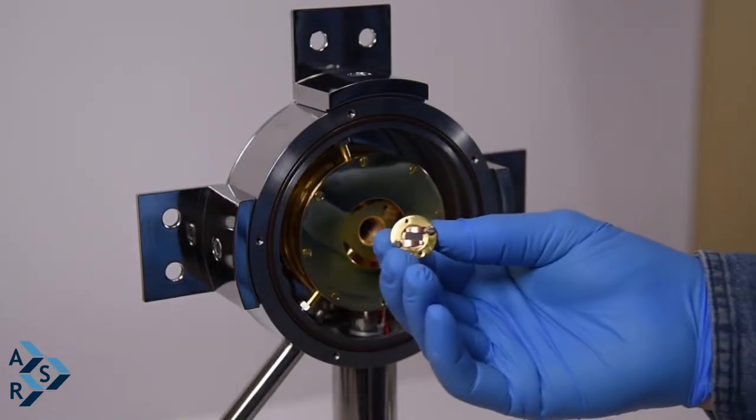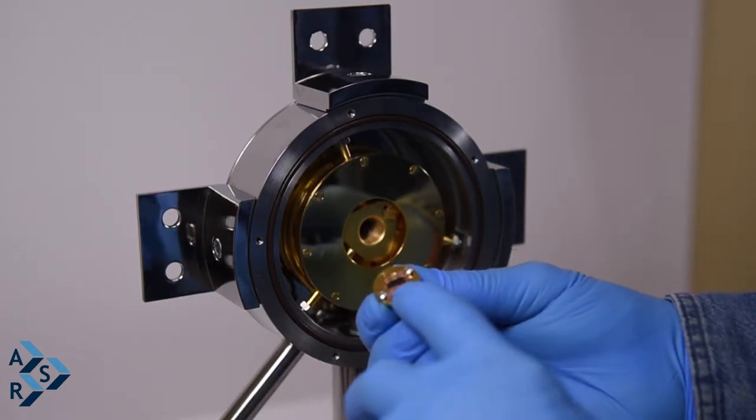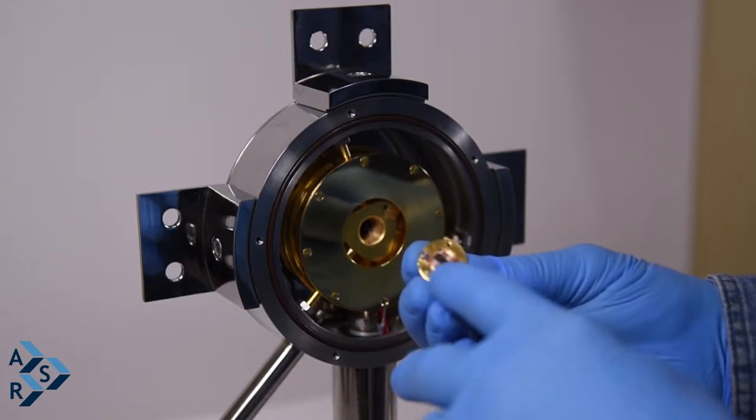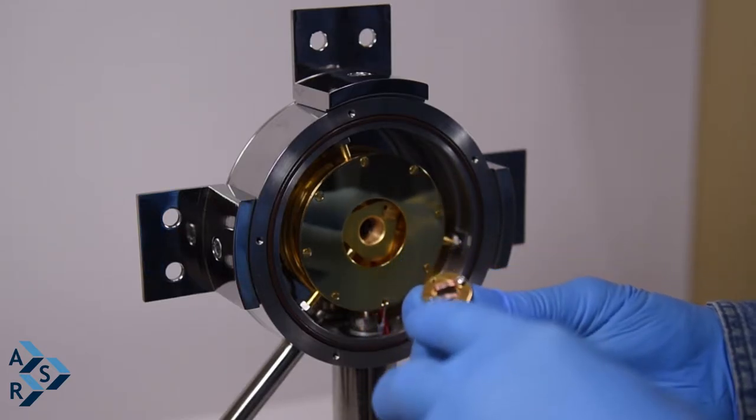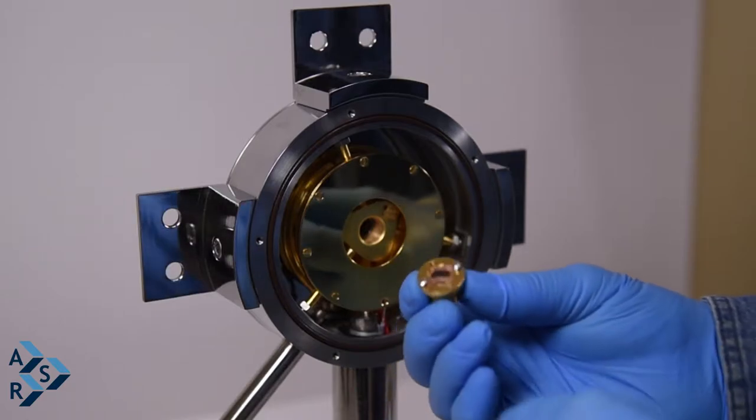Just to finish up, this is another sample holder that we also have designed. We have these copper clips, so they could help hold your sample, depending on what it is. They could be easily removed. You could put four in, two, one, all depends.